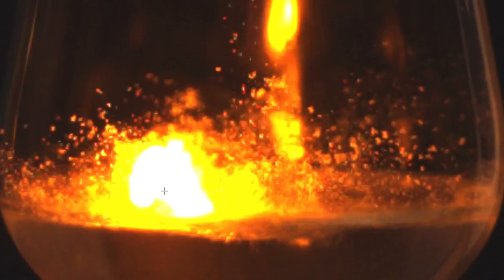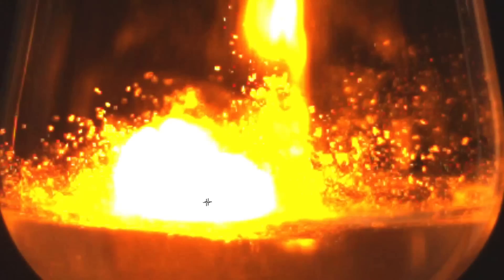This was just the very first attempt at doing this. I didn't put too much thought into the lighting because you don't really know with these things what the light level is going to be like. Yeah, that kind of burns out a bit, but obviously if I'd exposed it for watching the flame here you would see absolutely nothing. So I gauged it such that it was going to be fairly dark with the whole frame shot.